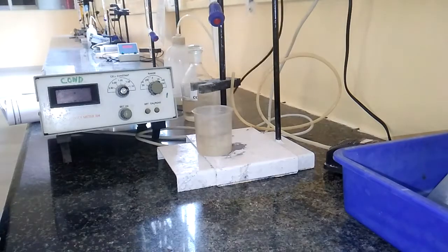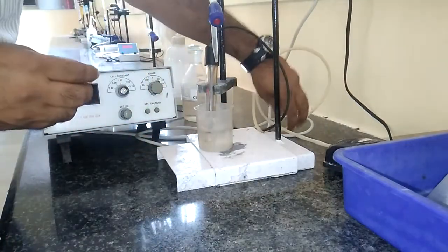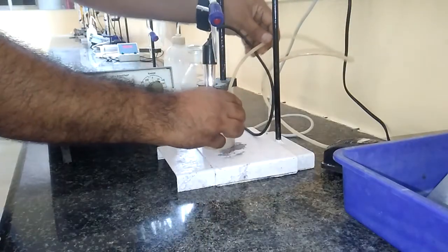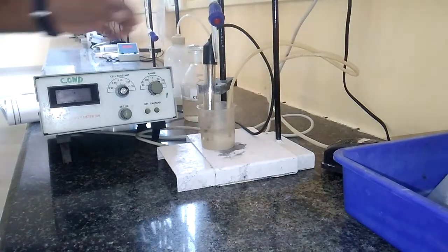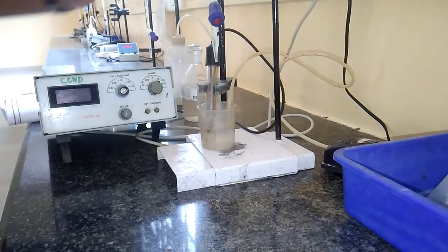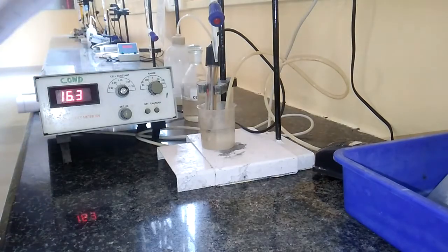Both strong and weak acid are mixed there. We have to immerse this conductivity cell into the beaker. I am going to immerse it along with the small rubber tube which acts as the stirrer, which mixes up the solution during the course of conductometric titration. Then, we need to connect this conductivity cell into the conductivity meter. We already connected it. Let us begin the experiment — we have to switch on these two devices.